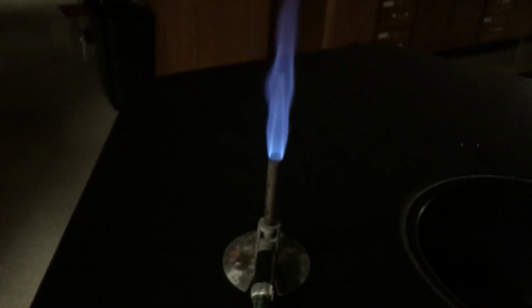So how can this be useful to us? Well, I've got an unknown chemical here, and it's one of the 7 that I've been dealing with, but I don't know what it is. It wasn't labeled except for saying unknown B. So this is unknown B right here. Now, if I run it up and down through the flame, it should give off a characteristic color of light as the electrons excite and then de-excite. From the excited state back to the ground state, they release light. Based on that color, I might be able to figure out which of those 7 it is.